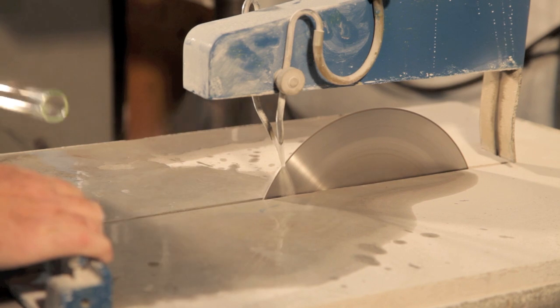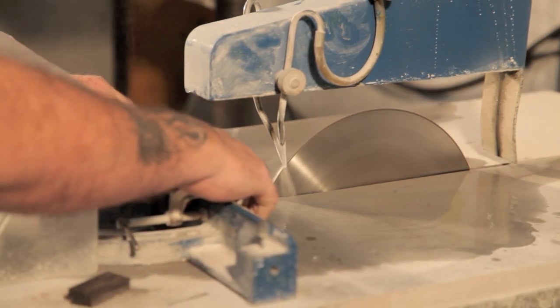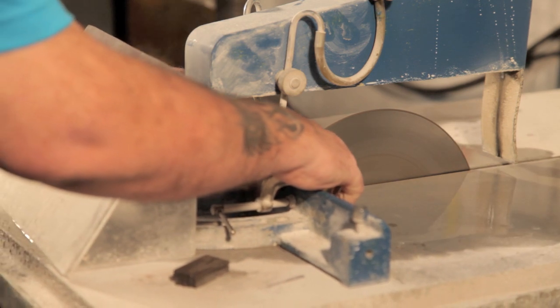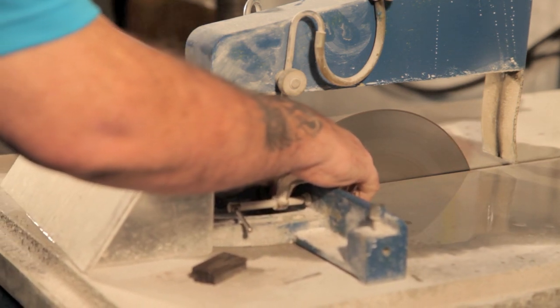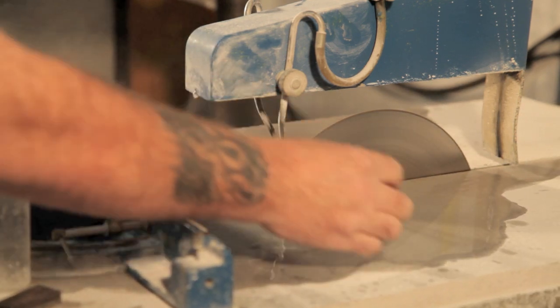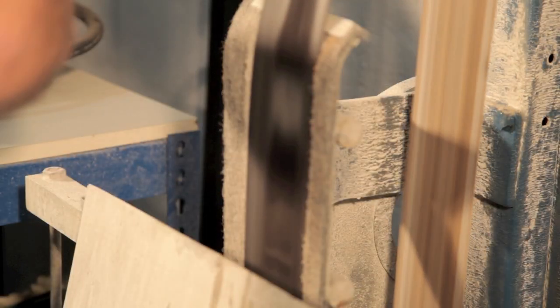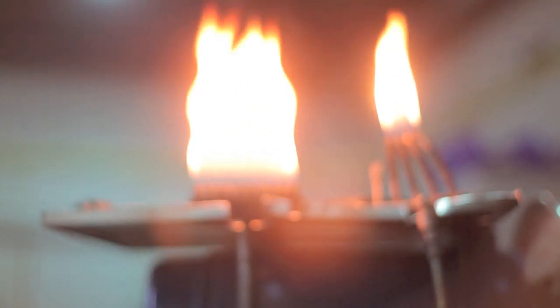All right, so here I am cutting the beaker feet from a tube of glass. Set to a certain size. This is cleaning the edges up now. And then we are on to the lathe, which we are going to make the beaker.